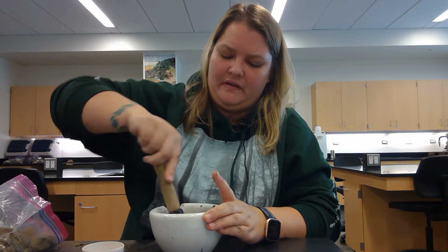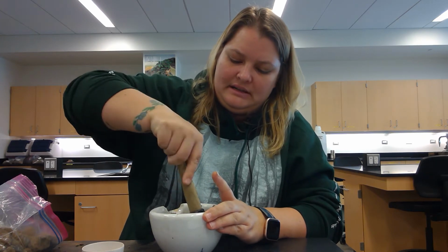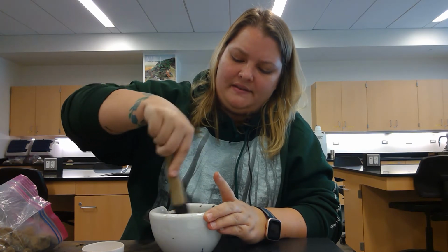All right. I think that's pretty good. Not all of the aggregates are broken up, but they're at least smaller than they were before.